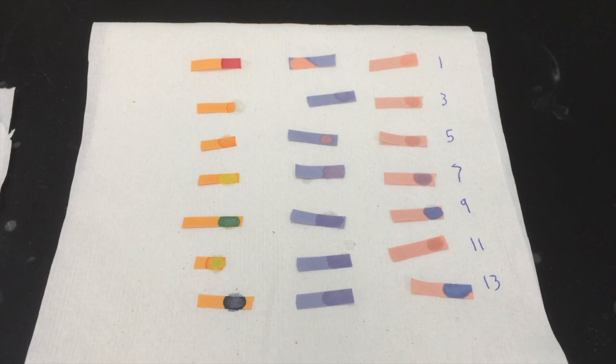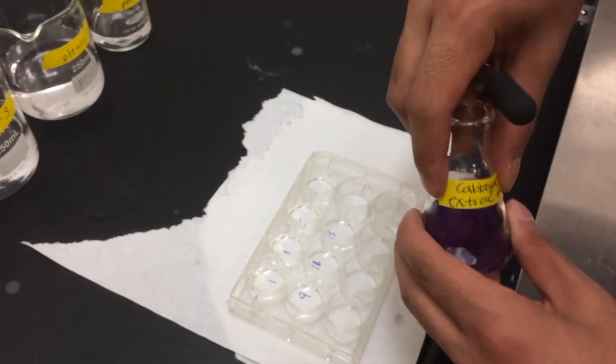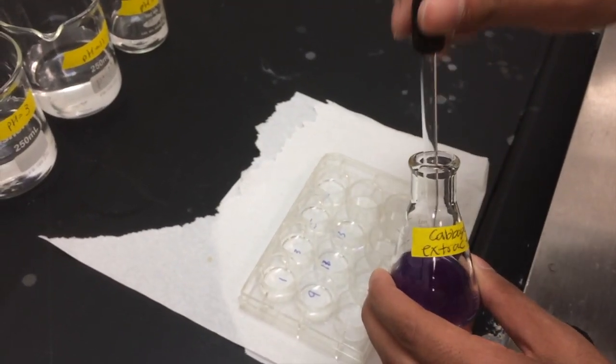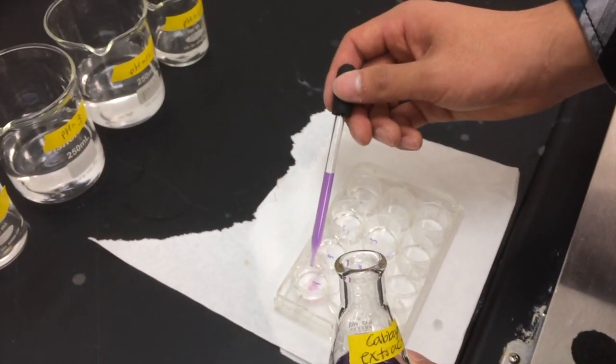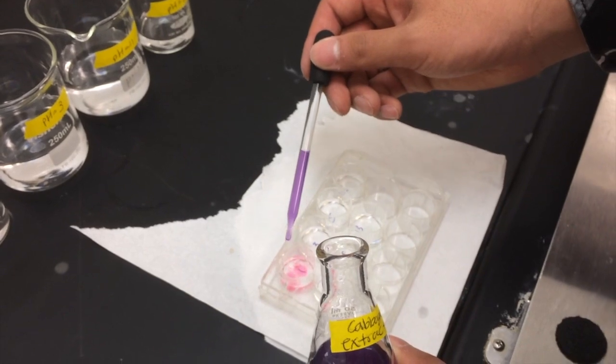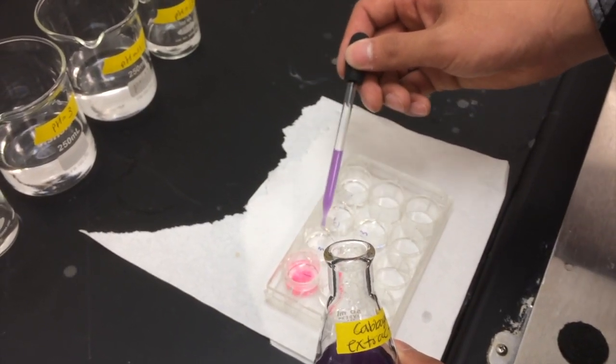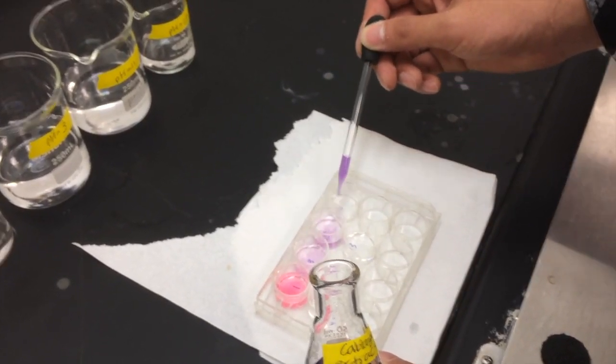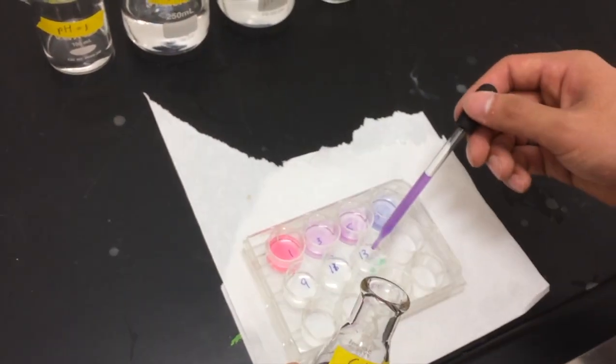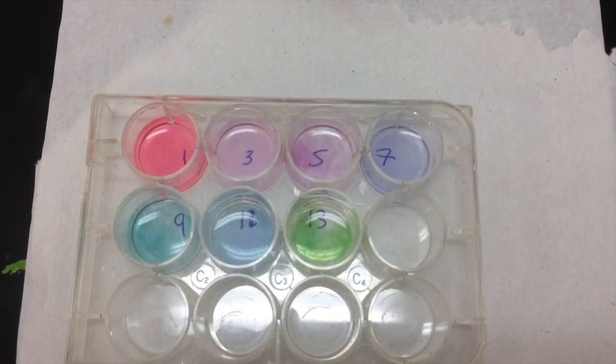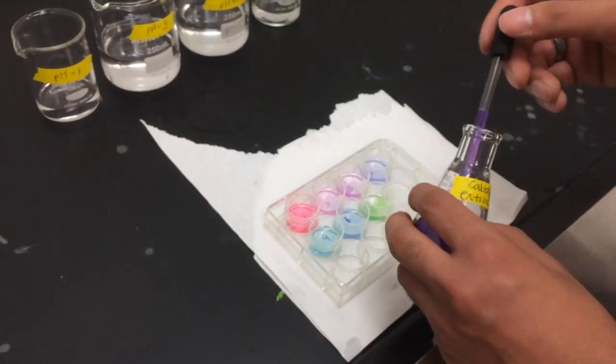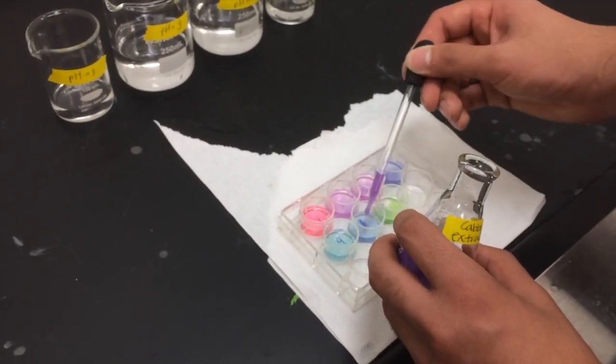You should see something like this. We've added a bit more to make the colors appear more vivid in this video.